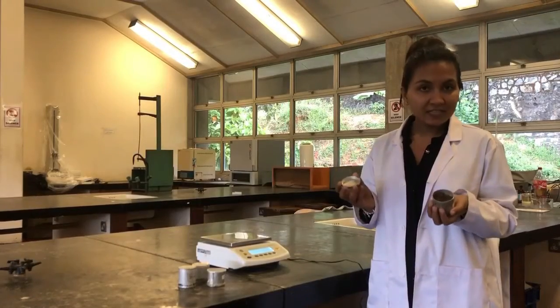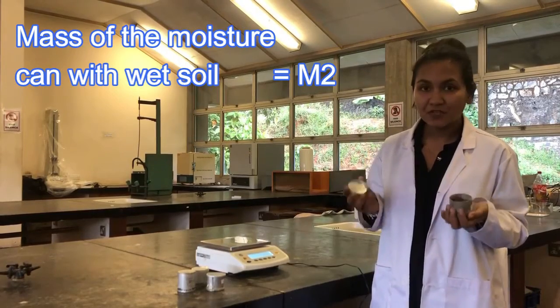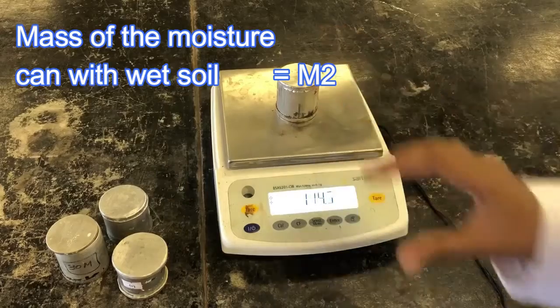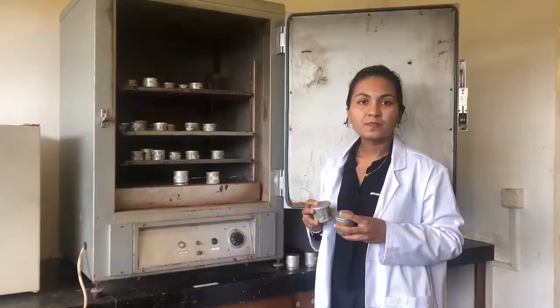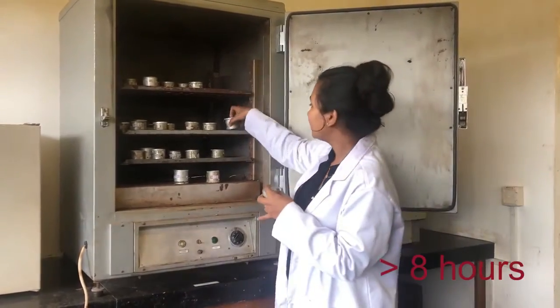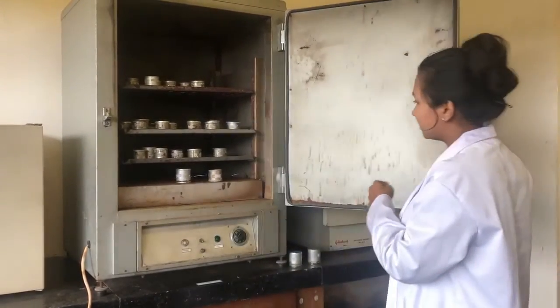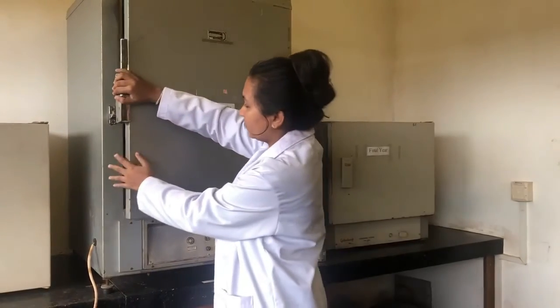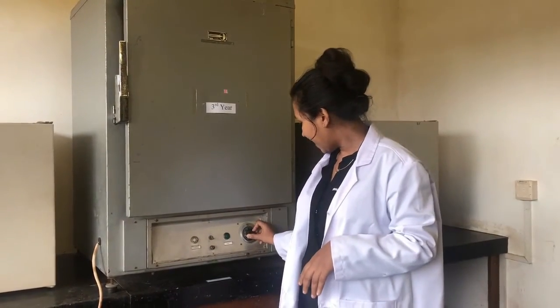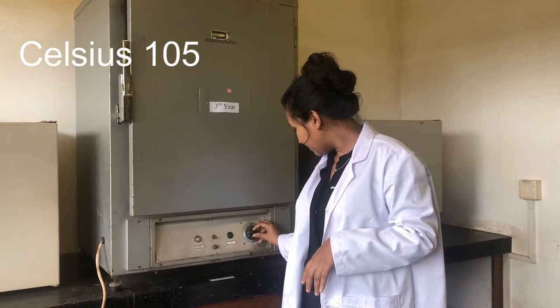Now we have taken the collected soil samples into the laboratory. Let's measure the wet weight of these samples. Then we keep them in the oven for drying for more than eight hours.